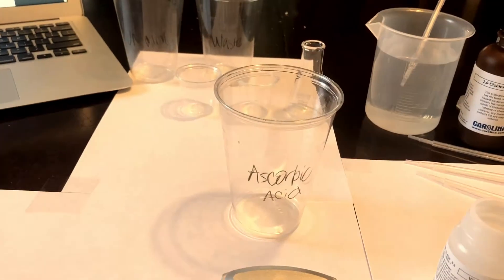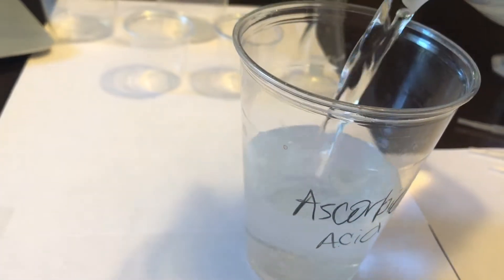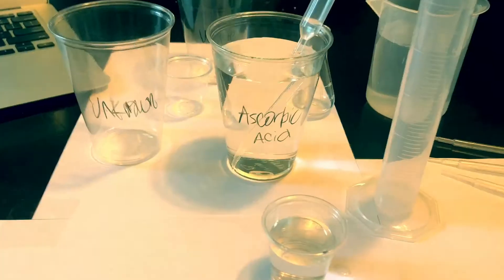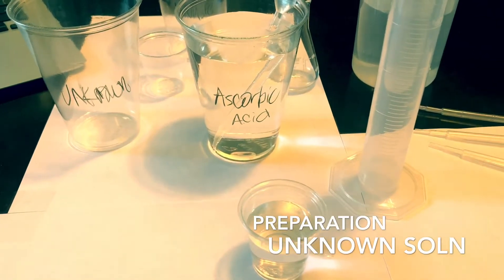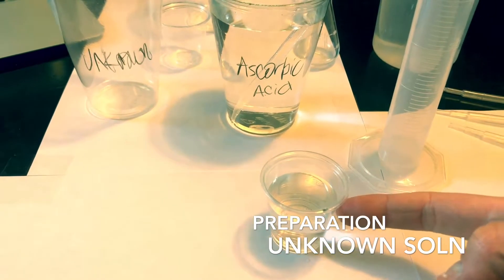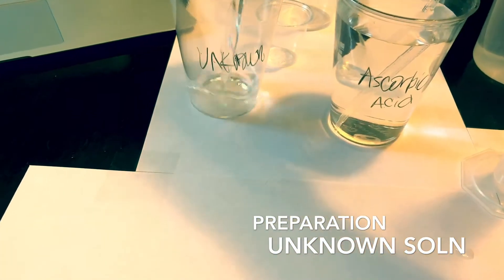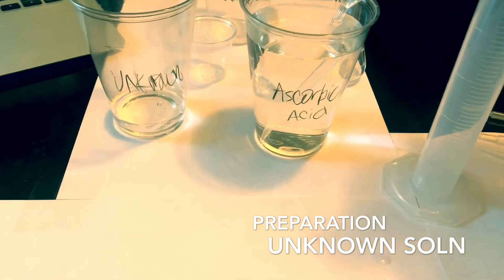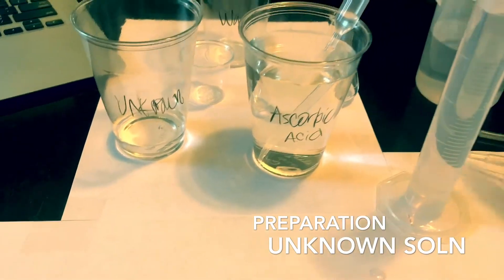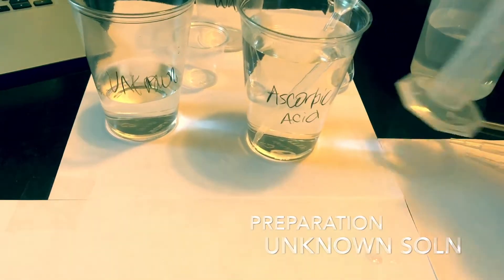Then we can prepare the sample of unknown concentration. We're going to prepare our unknown solution. Fill the medicine cup 50 to 100% full with ascorbic acid — we filled it about 75% — and then put this in our unknown cup. Then we will put 50 ml of pure water into it and stir it and put a pipette with it.